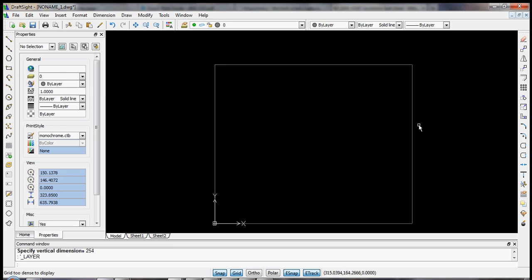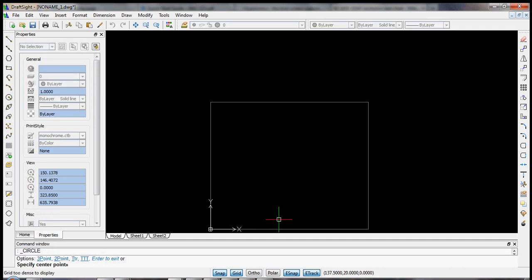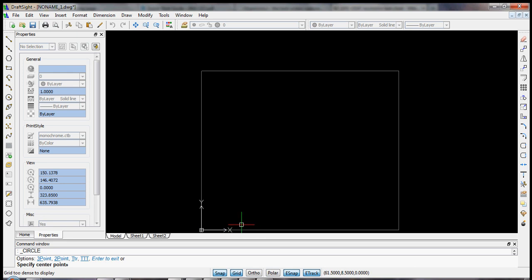Okay, so the first thing we need to do, this is our 10 by 12 inch sheet. We need to have our printouts with a half-inch border. Let's say it's roughly 15 millimeters. And so we want to lay out our roughly 4-inch wafers. Well, since we're using millimeters, let's say it's a 100 millimeter diameter. And so we've clicked on the circle tool. The center point, we want it to be centered, let's say the radius will be half of 100 or 50. We want the border to be 15 millimeters from the end, so we simply add 50 and 15. That gives us 65. So our center point could be 65 by 65.